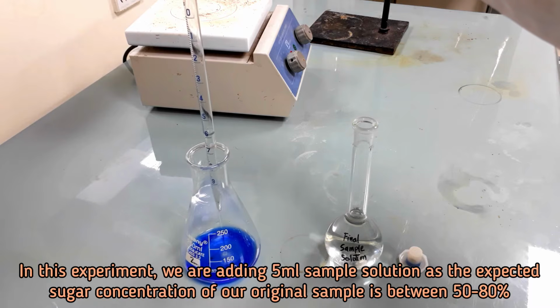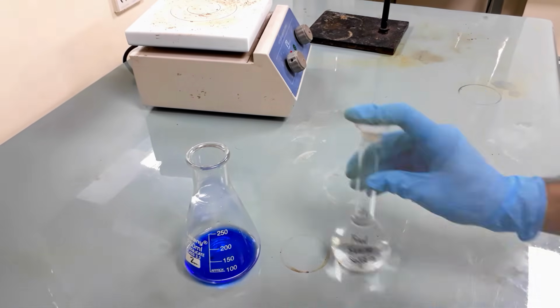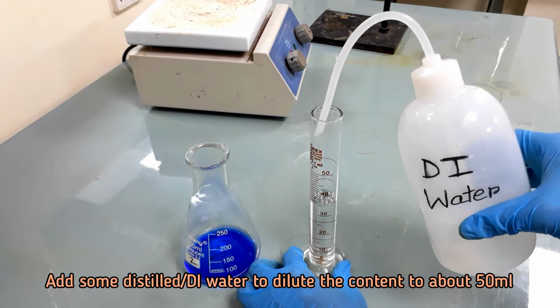In this experiment, we are adding 5 ml sample solution as the expected sugar concentration of our original sample is between 50 to 80%. Now add some distilled water to dilute the content to about 50 ml.